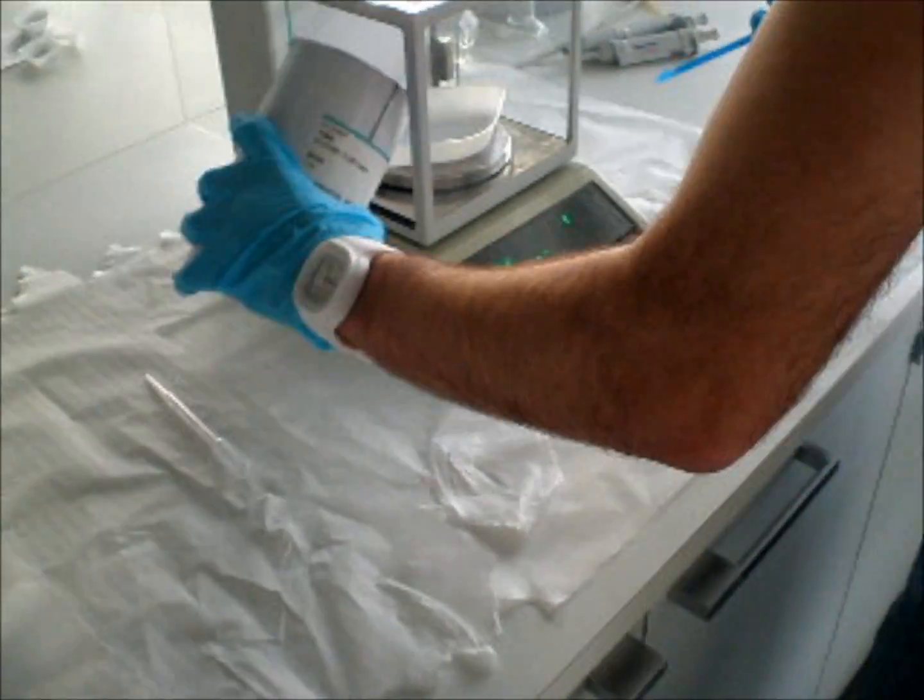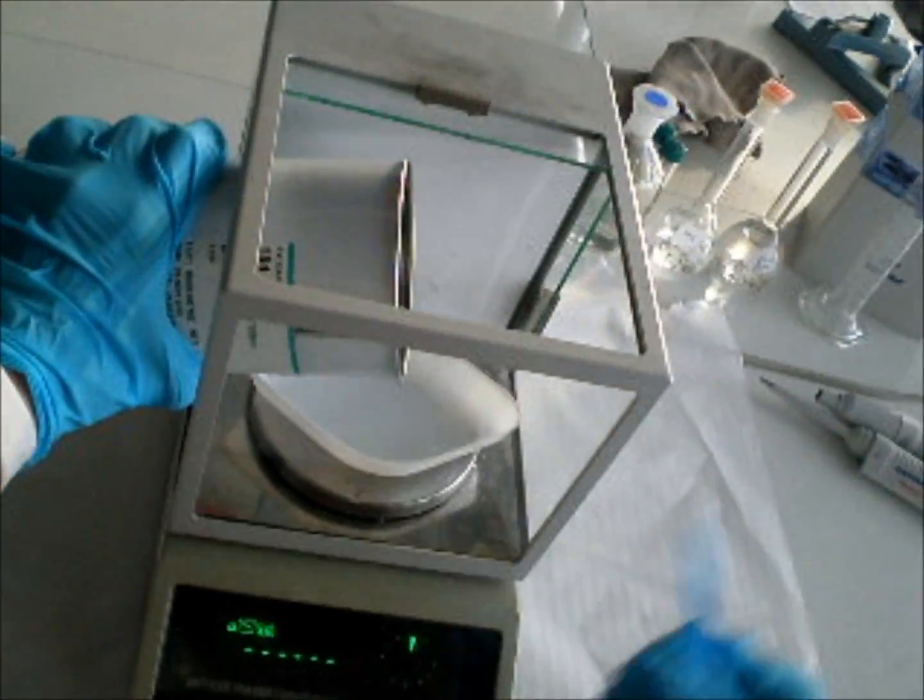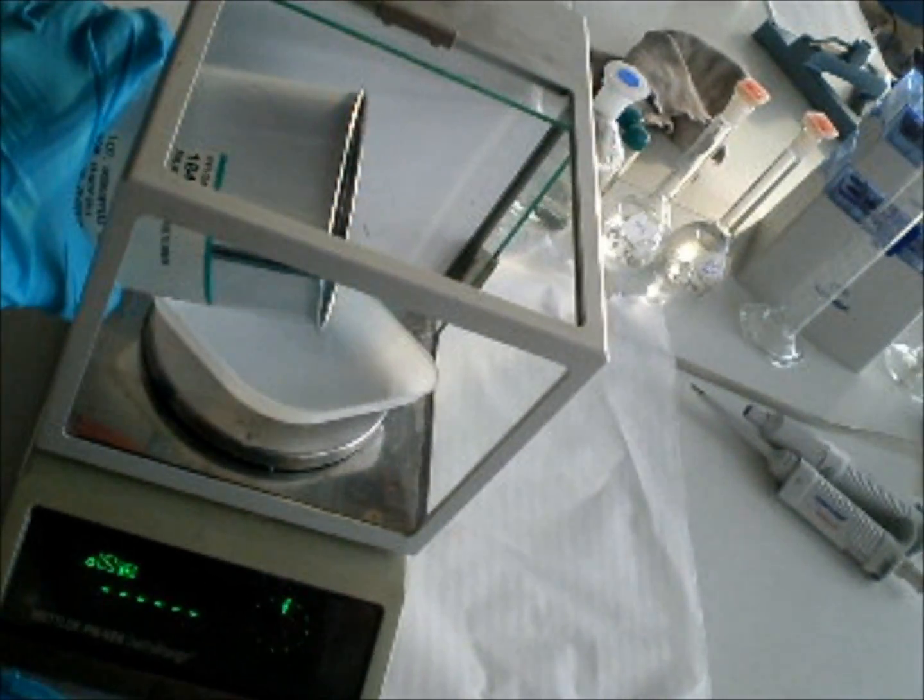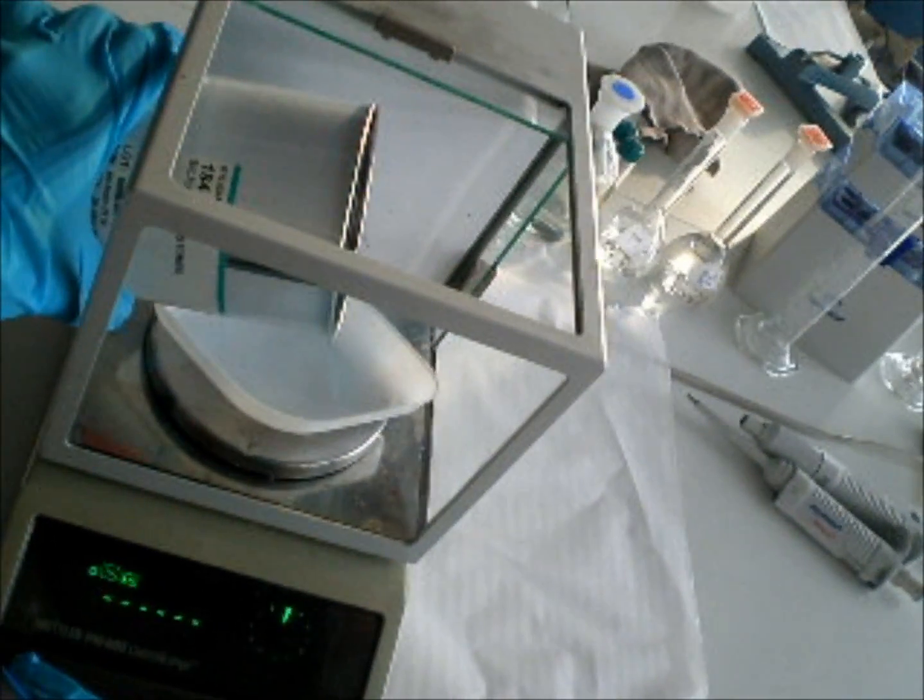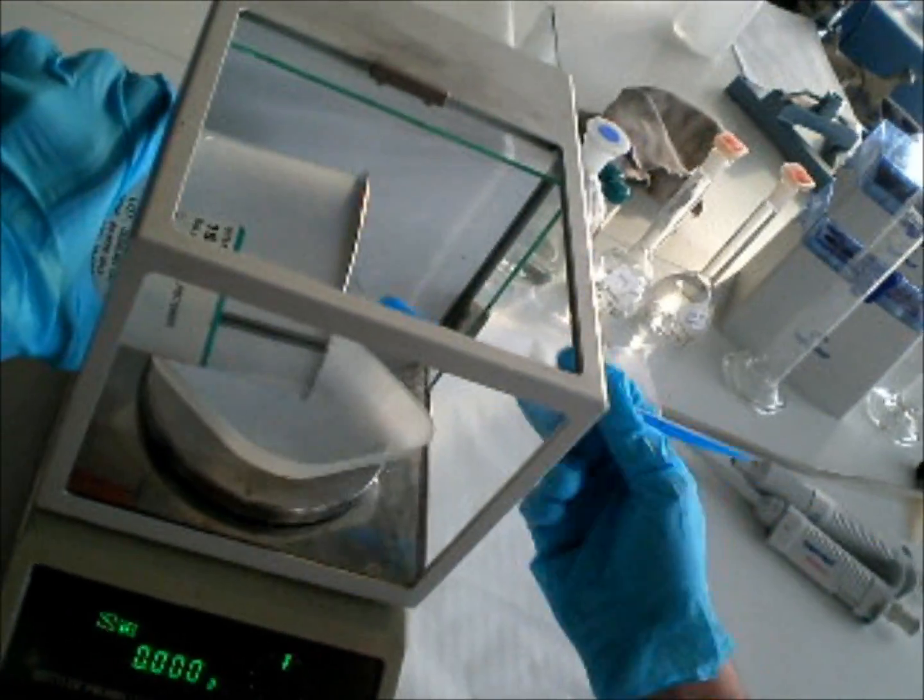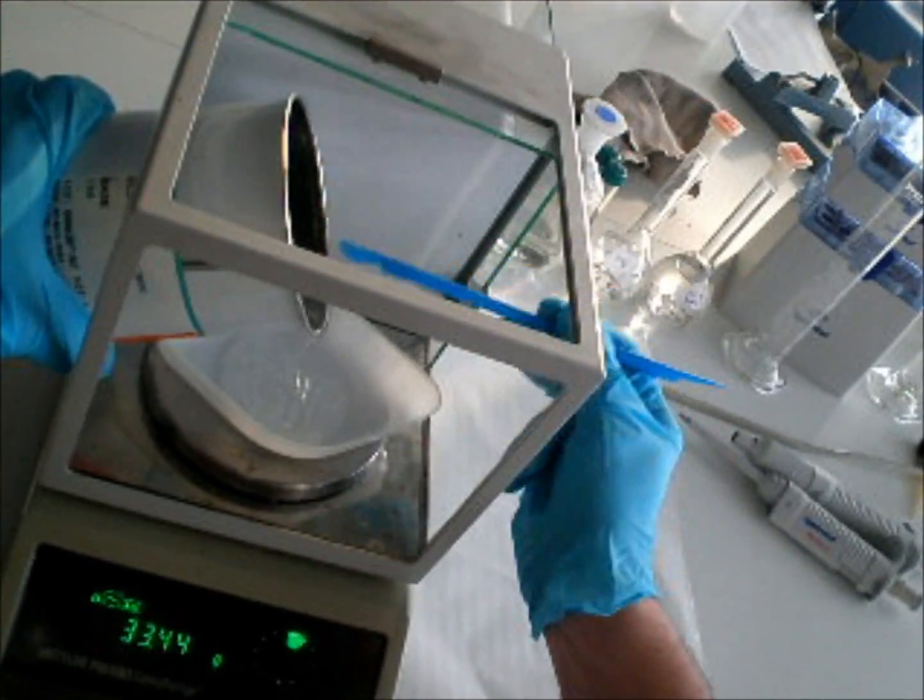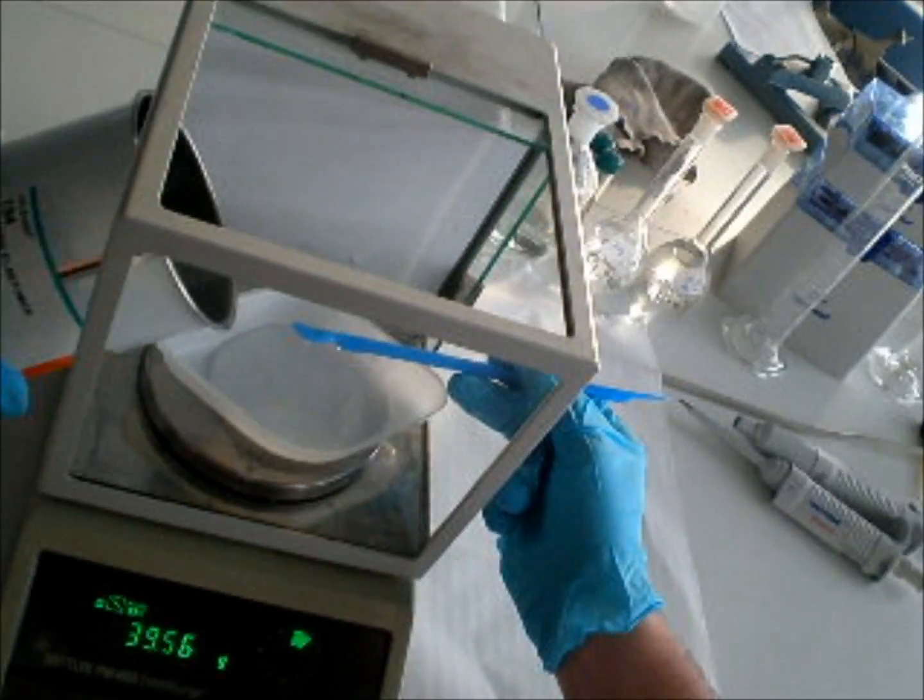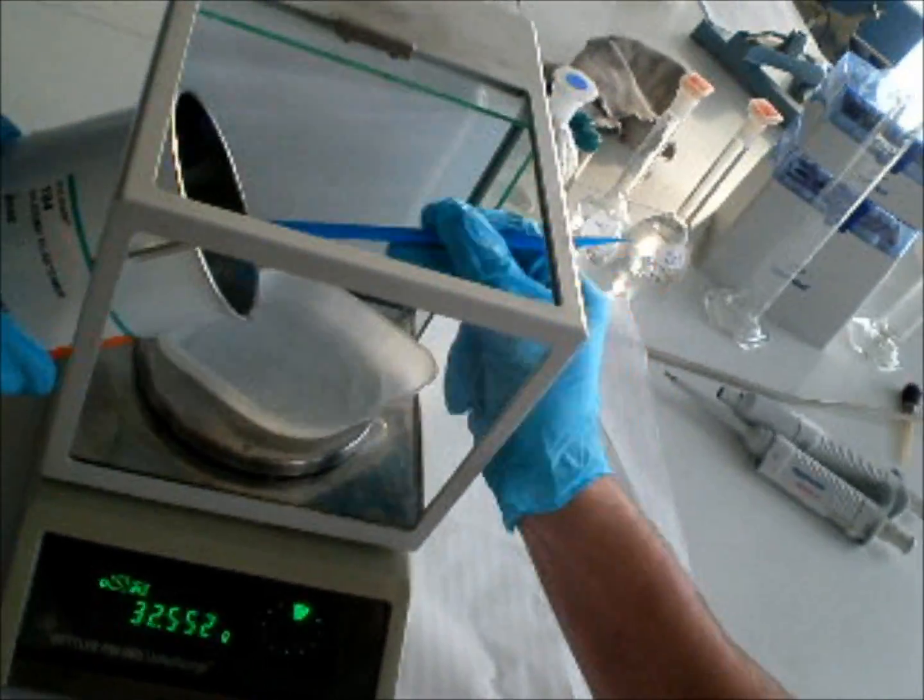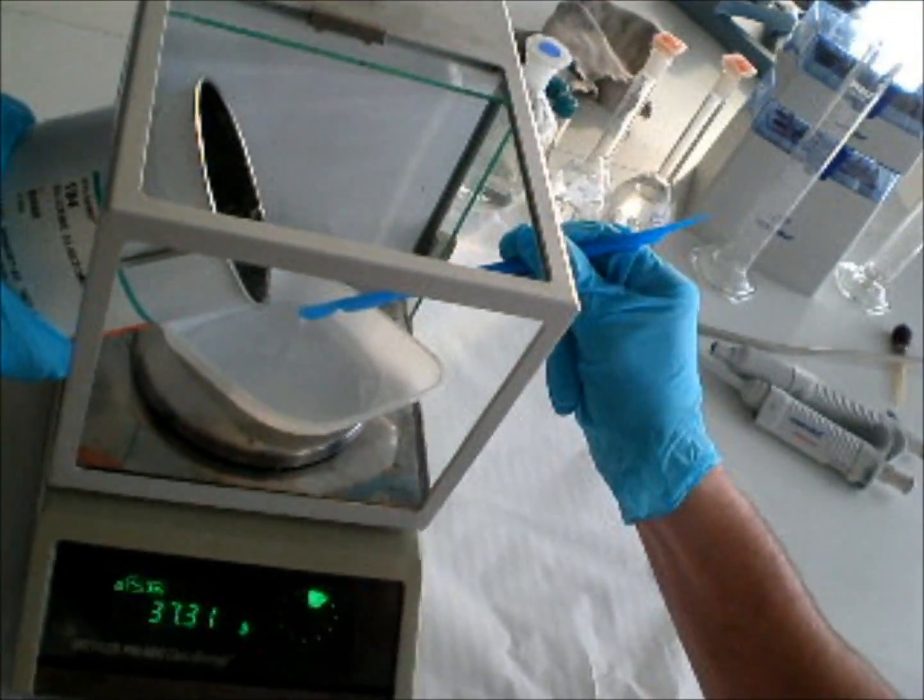And then we put some silicone. Yes. I will put 30 grams. 40. 32 grams. And I will make 35, so I will have enough.